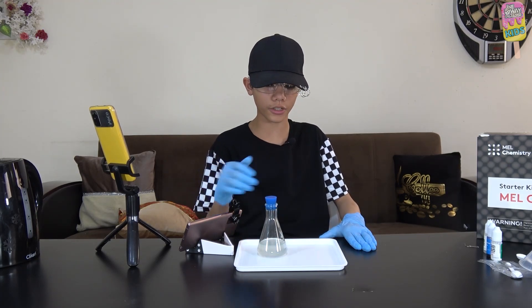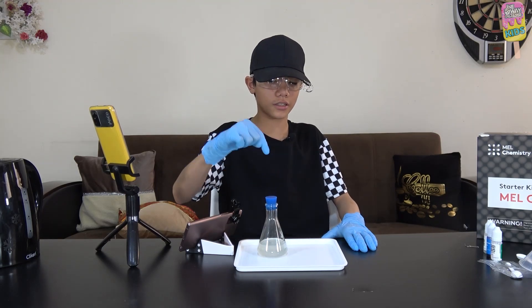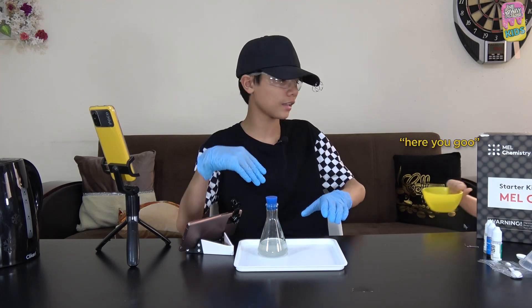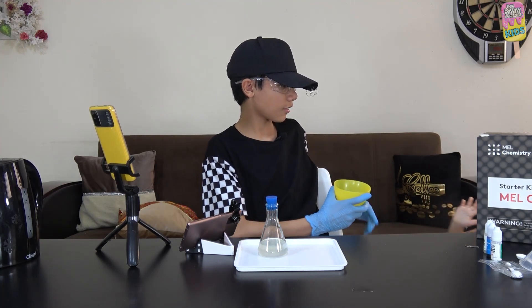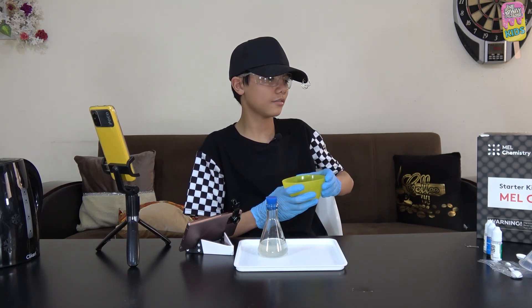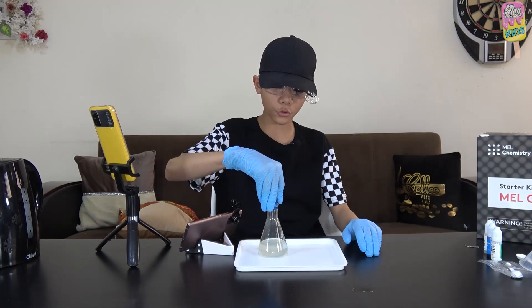This is pretty cool. We can shake it as many times as we want and repeat the steps until all the air inside the flask runs out. But even then, you can open the stopper, allow more air in, and do it again. This was pretty cool and very simple.